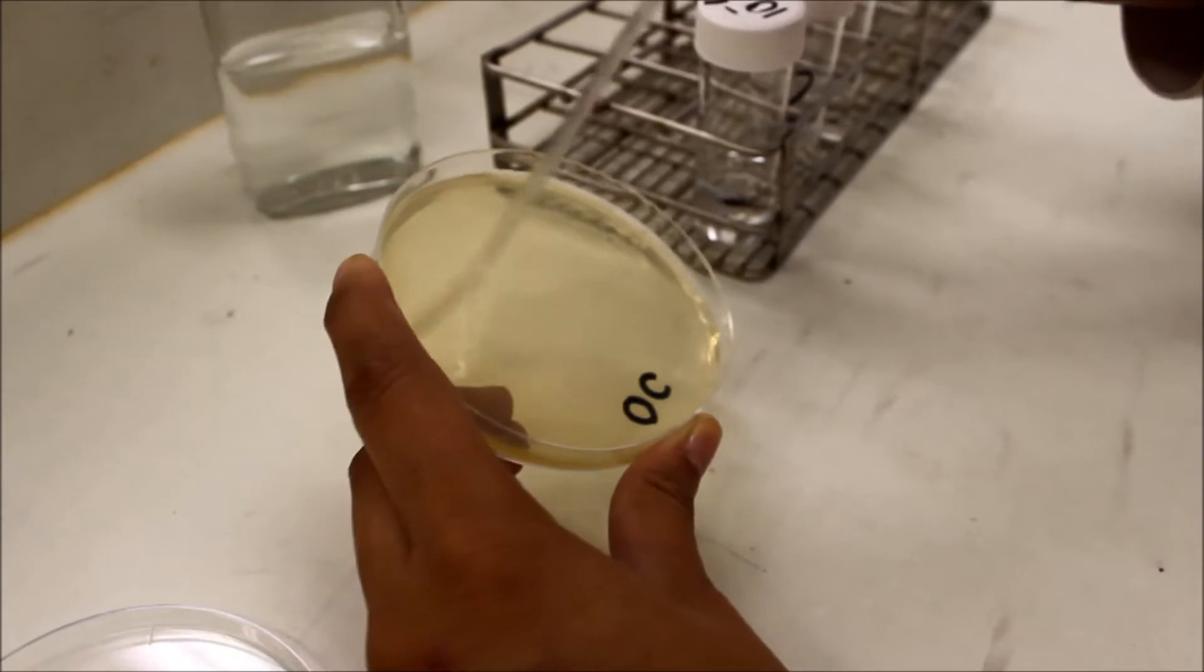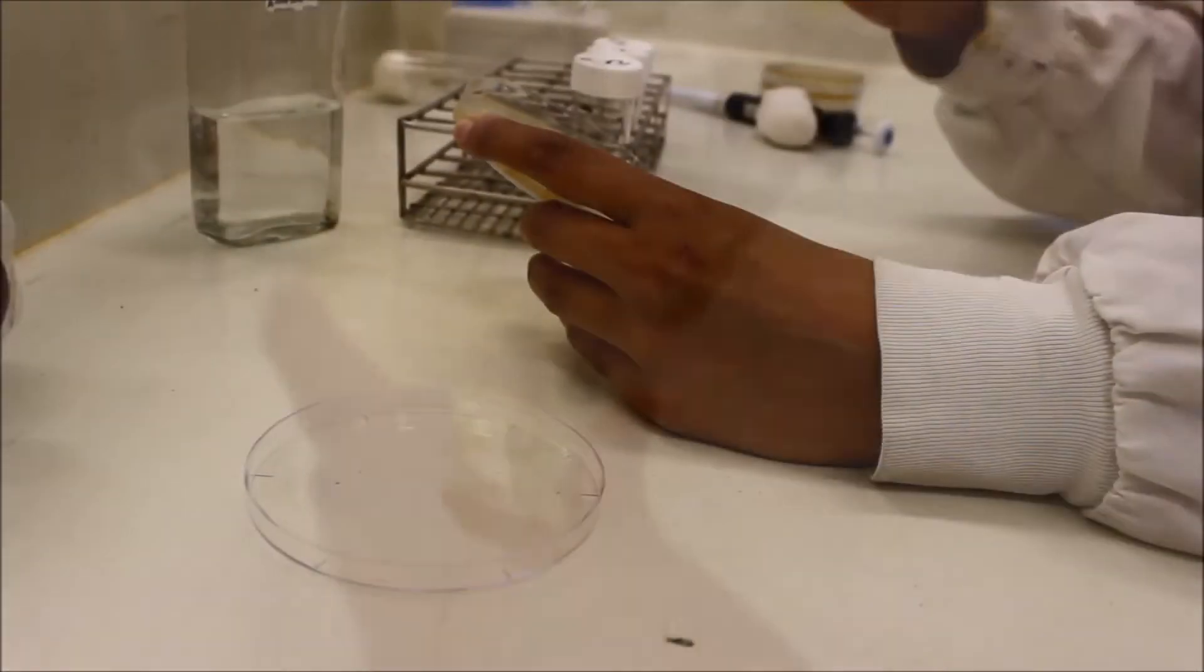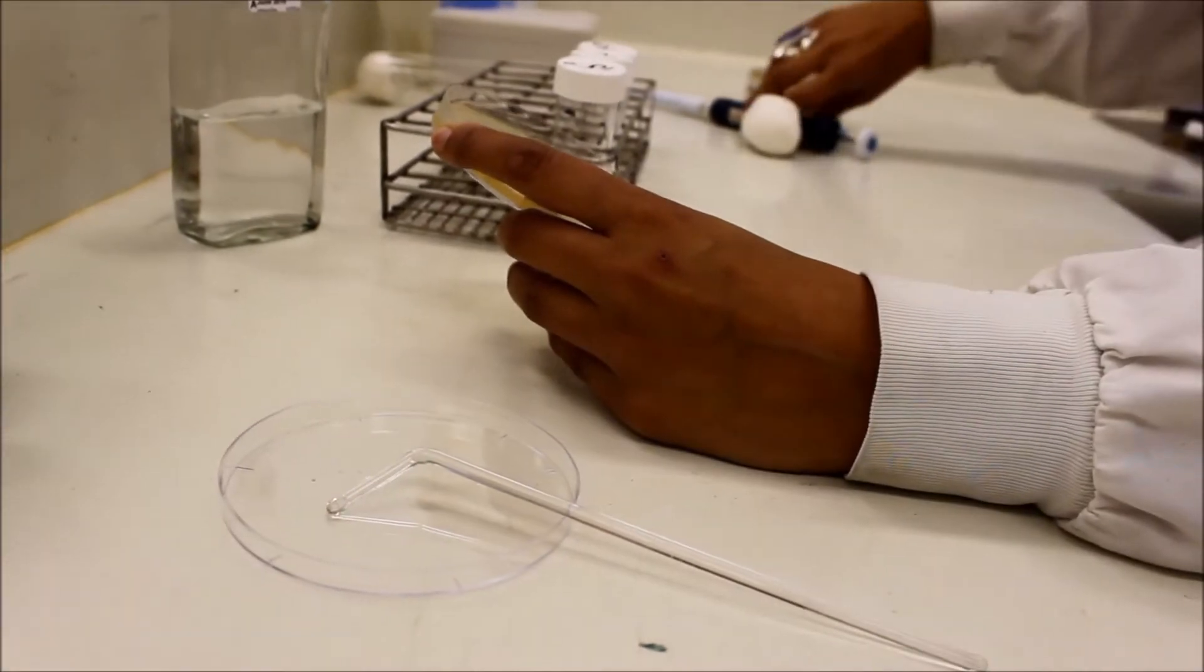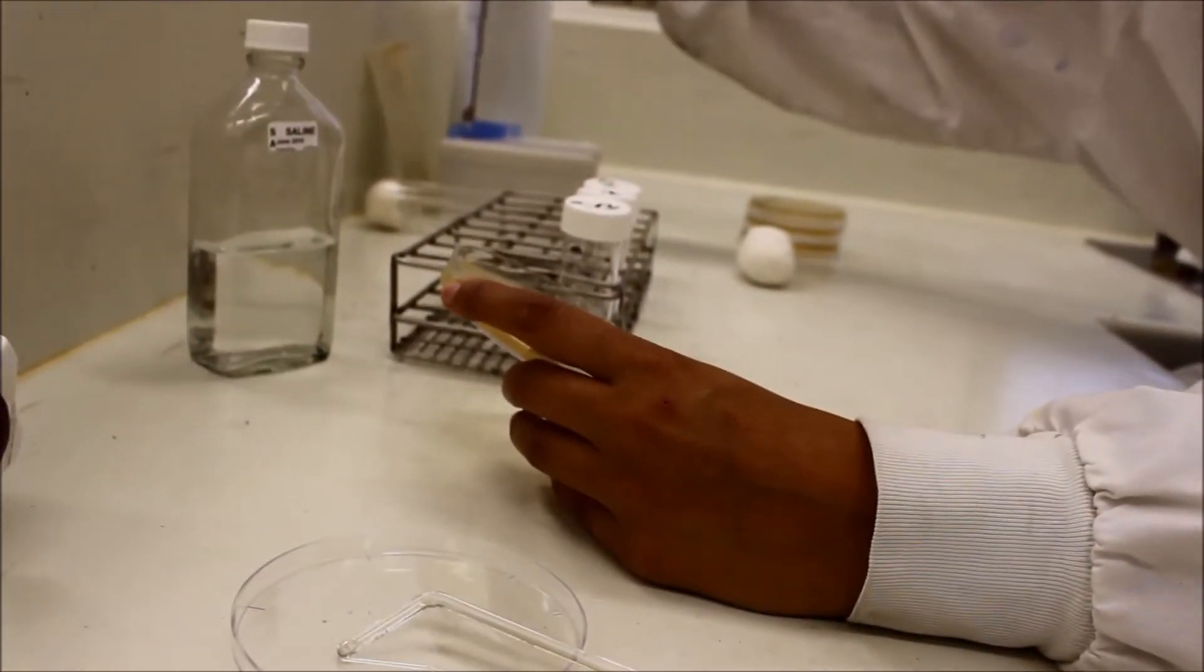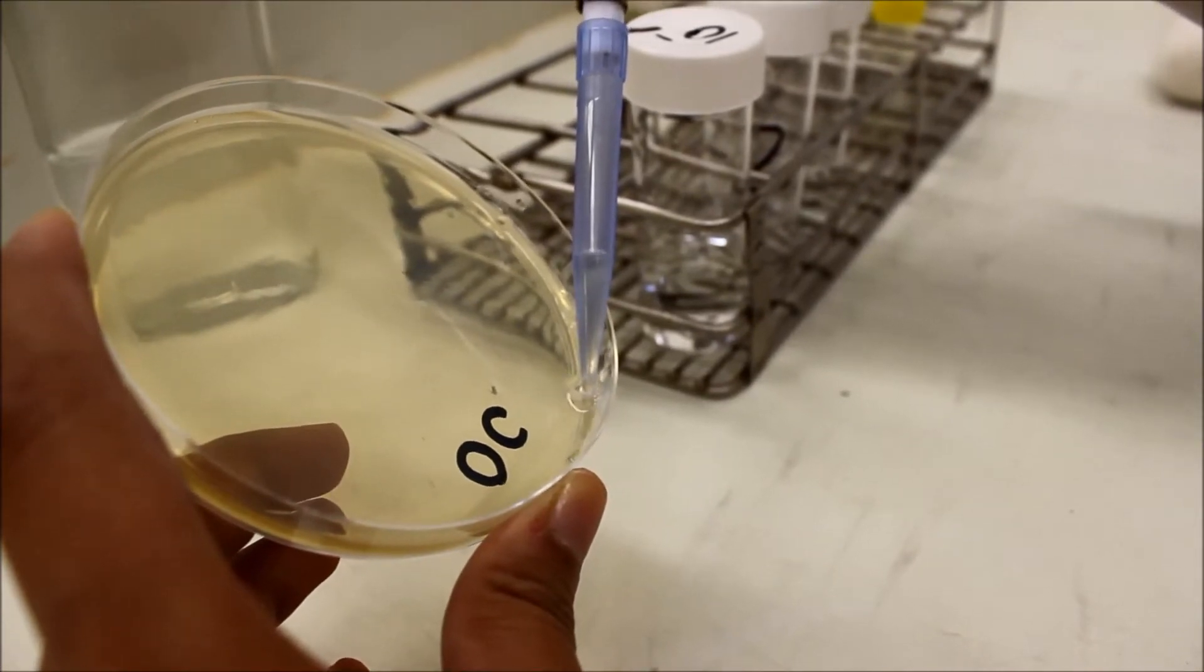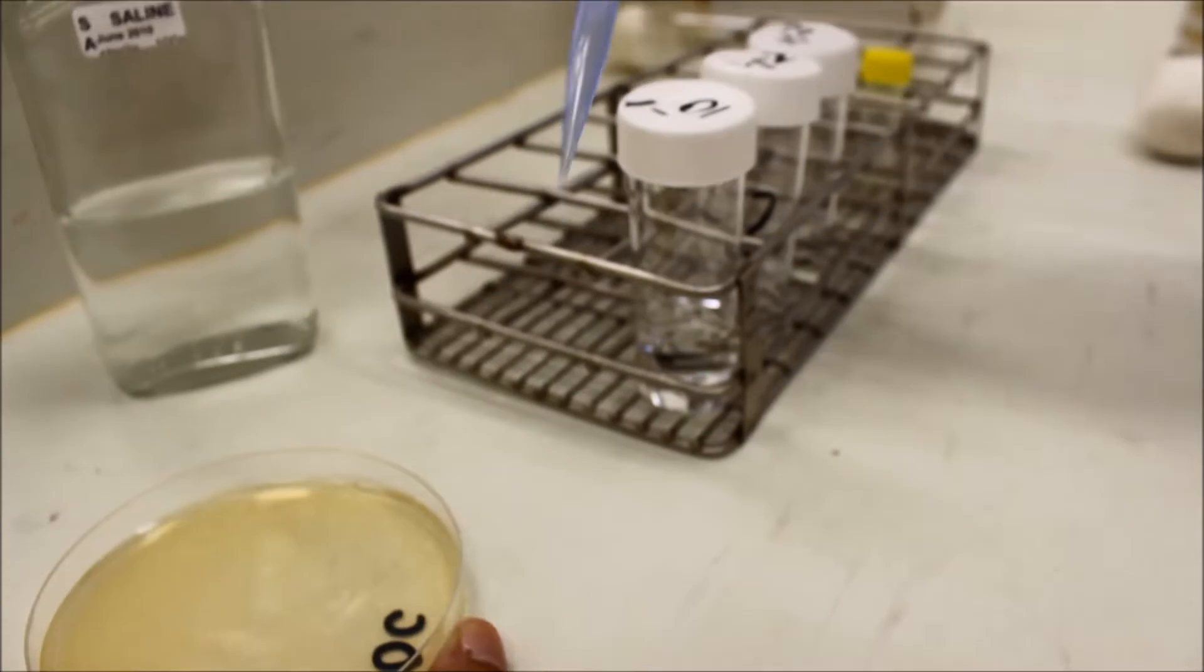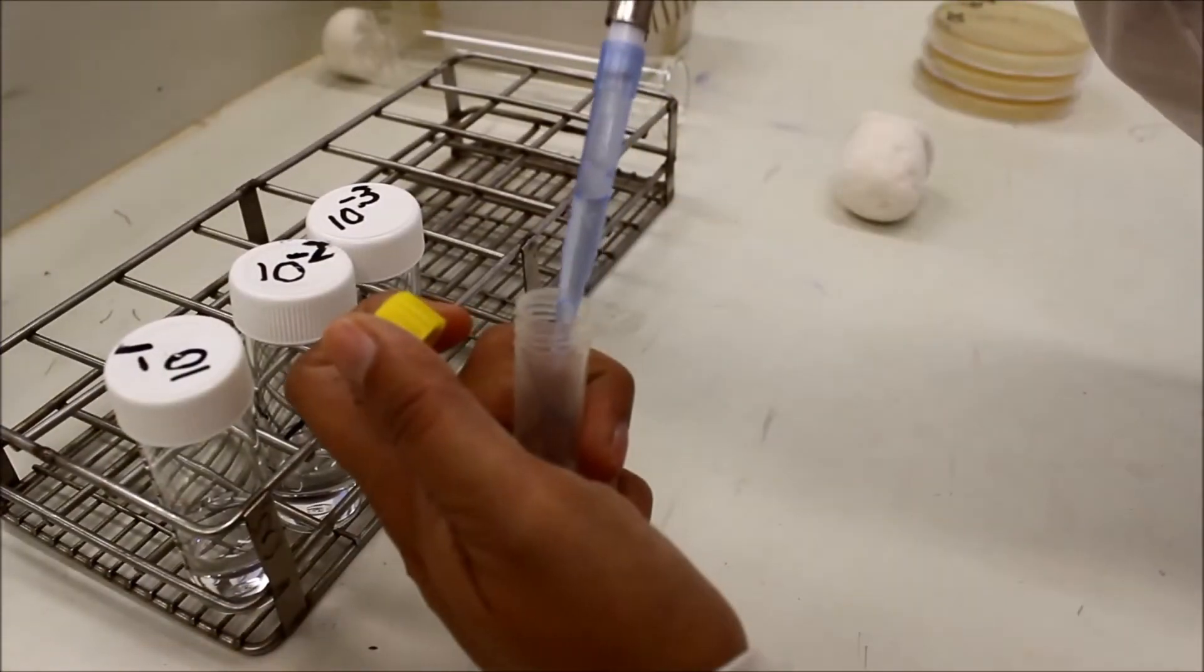When collecting each one milliliter back, you should only be able to recollect approximately half a milliliter. Collect the excess saline in a sterile container.